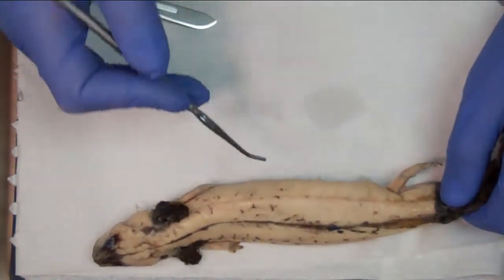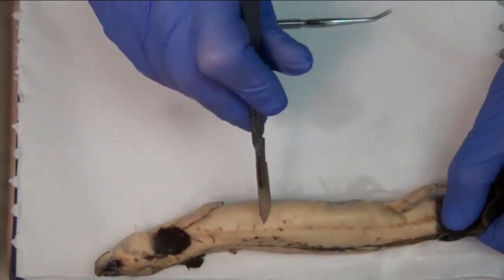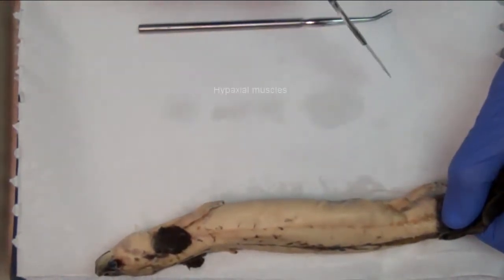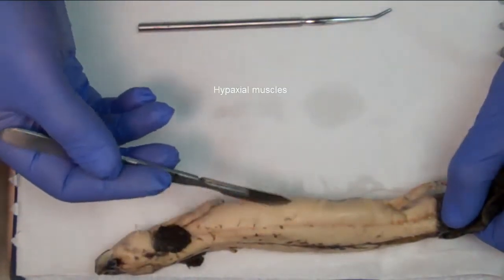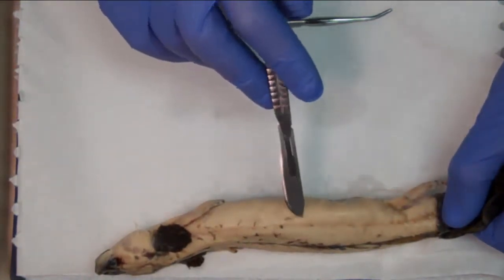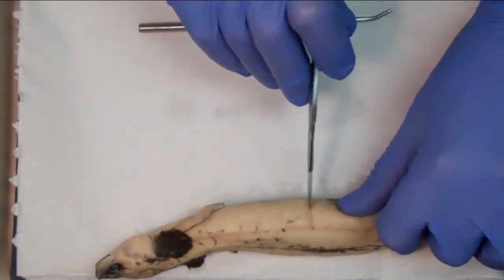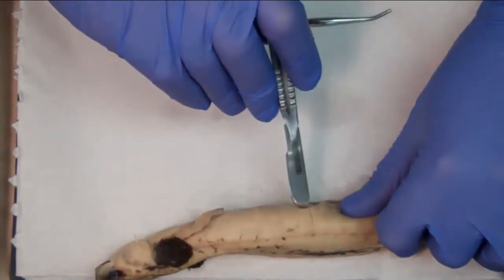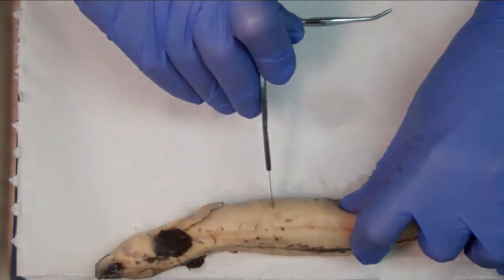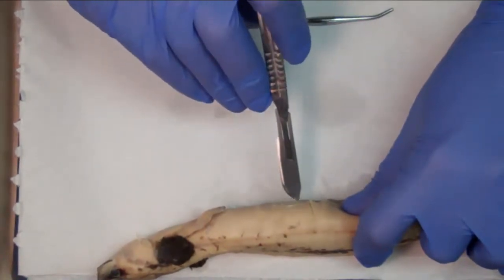The bottom part of it, you can see the fibers here. I like to exaggerate them a little bit, but the fibers move in this direction. And that's the hypaxial musculature. Above the line, epaxial; below the line, hypaxial musculature. If you go into the hypaxial musculature and cut a window through it, you can go deep a little bit to get both layers that you have there. You're going to see that the internal layer of muscles is going to be a little bit difficult for me to peel off, but I will try my best here.